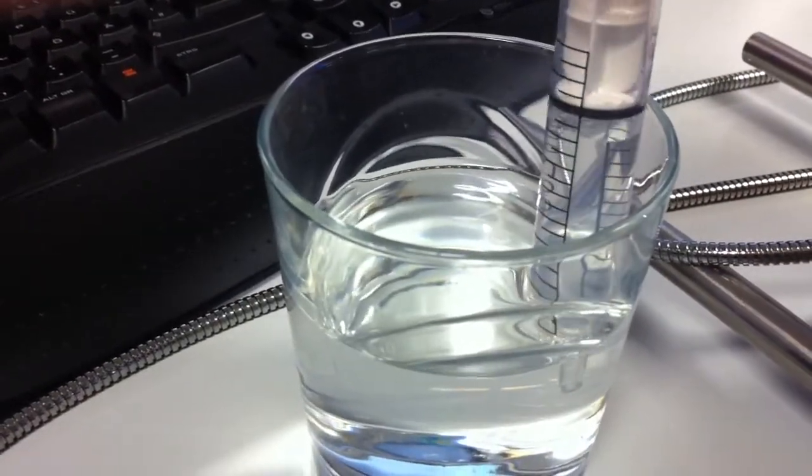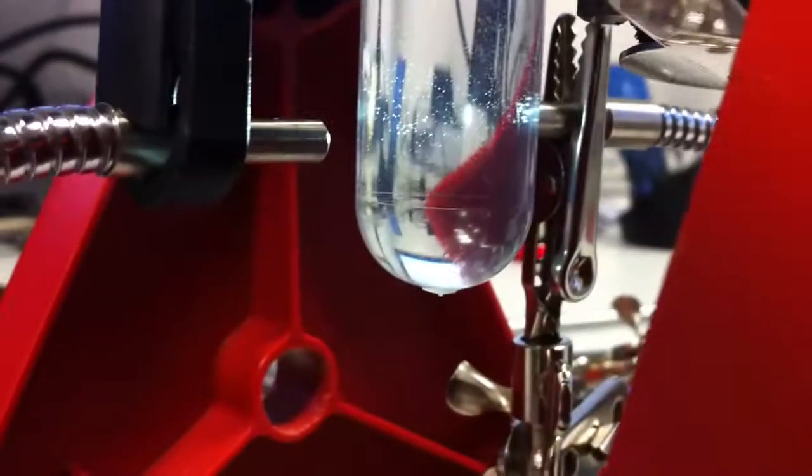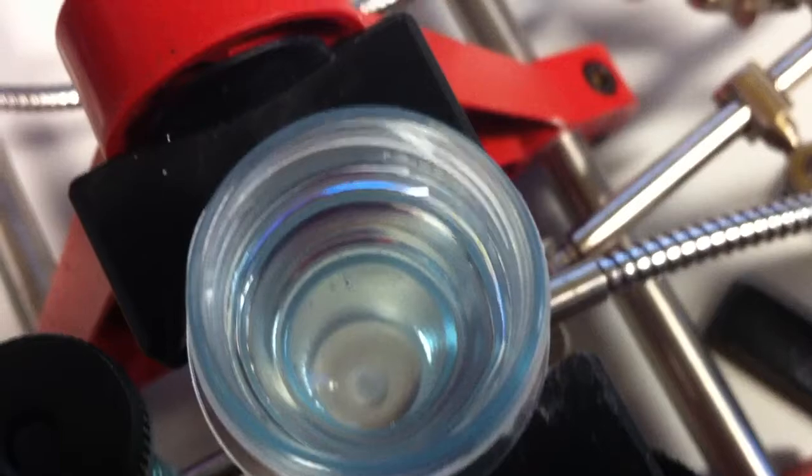Therefore we have to adjust the sensor. First I took the water, 2x10ml, so overall 20ml pure water.